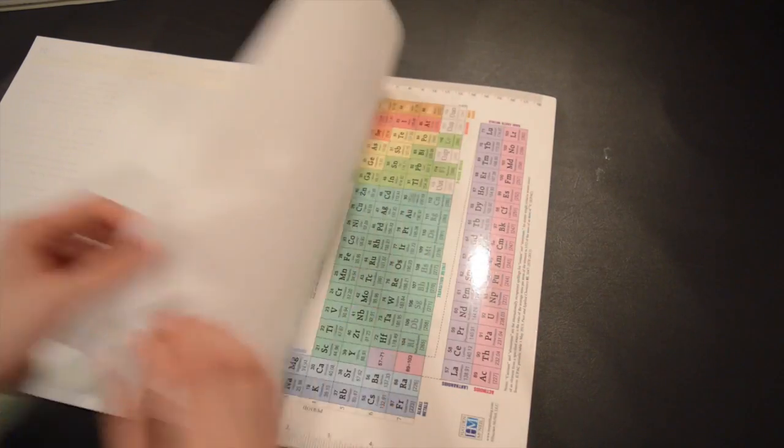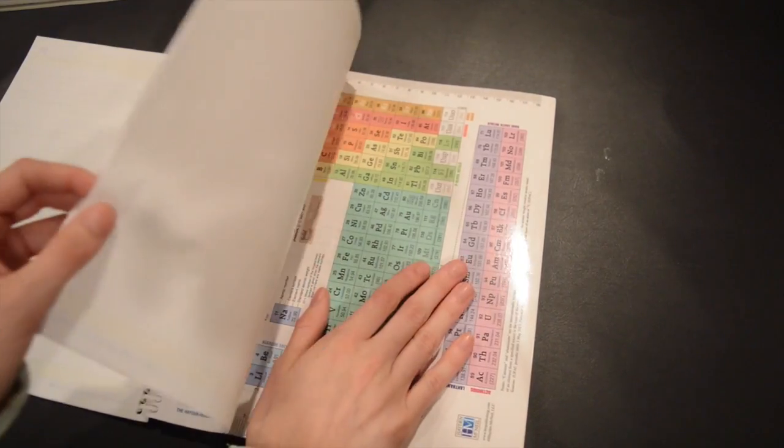I'm going to have my two page-eight pages on top of the divider, which means you're ready to write. It's important to remember that when working in your lab notebook you want to use a pen in order to make sure that the information is going to copy onto the copy page of your lab notebook.